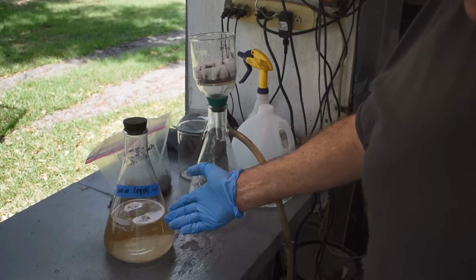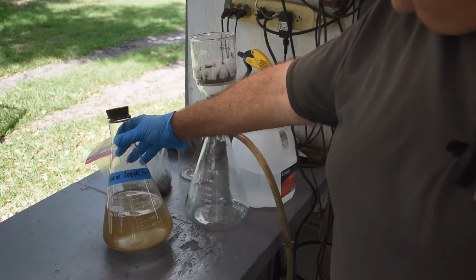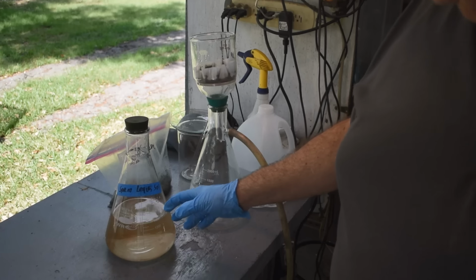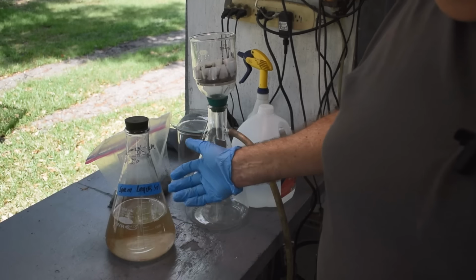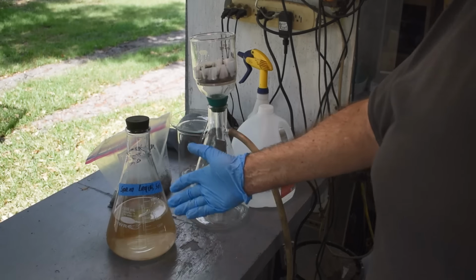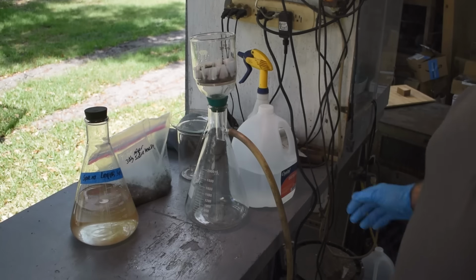We're right about exactly where we started, right around 1400 milliliters. I'm trying not to dilute it too much so that I can reuse it over and over again. At some point I'll probably have to add some more potassium iodide and crystal iodine to it just to keep the strength up, but I managed to get through this batch without really diluting it, so that's great.